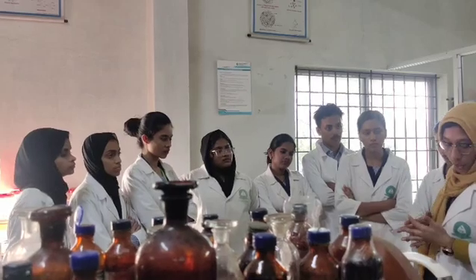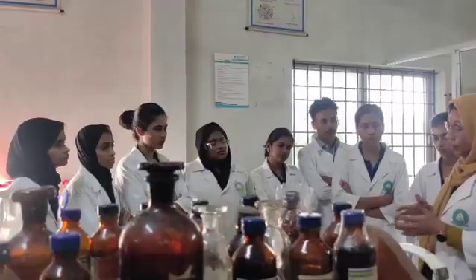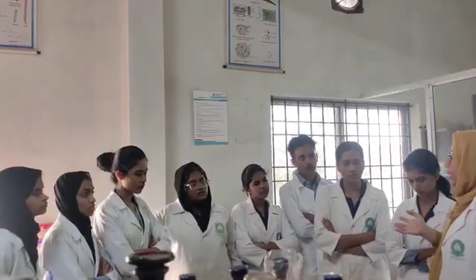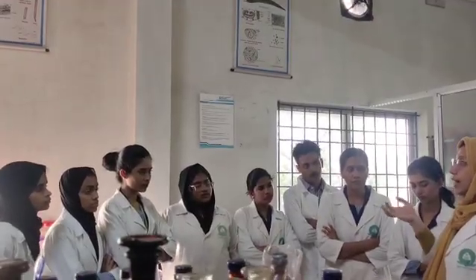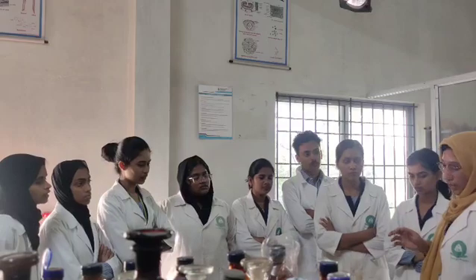For that we take an aqueous solution of agar, equal volume of hydrochloric acid, keep it in a water bath, and add barium chloride solution, which will form a white precipitate. Then to the agar solution add ruthenium red solution, and a red color is formed. So ruthenium red is added to the aqueous solution, and it forms a red color, indicating the presence of agar.